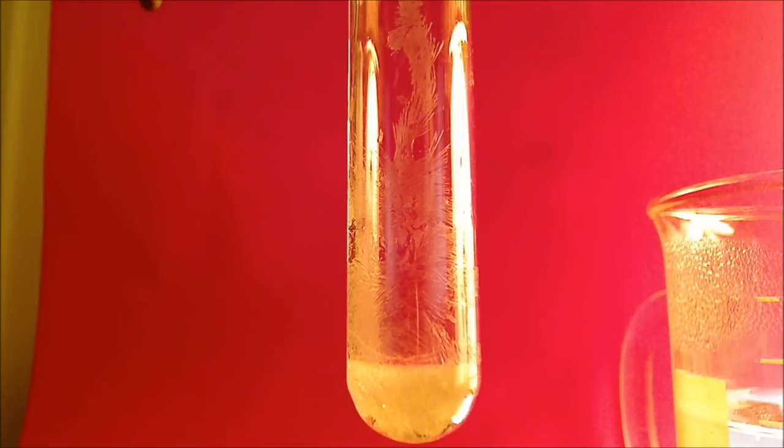Okay, well, the paradichlorobenzene, or mothballs, have gone from being melted back to being recrystallized. And you can see them in the test tube here.